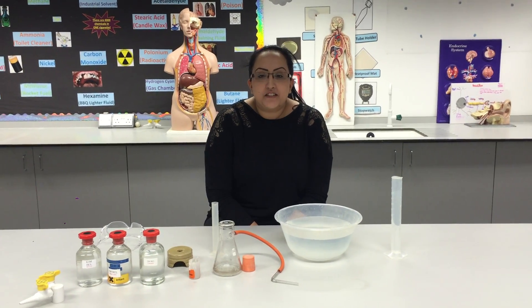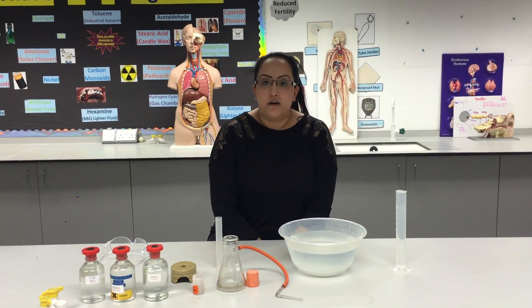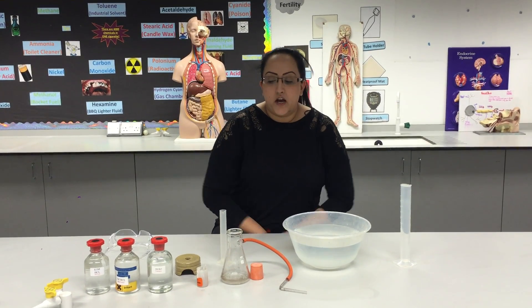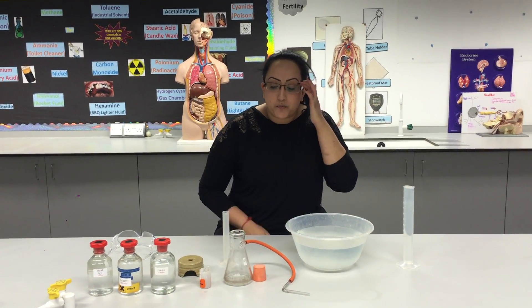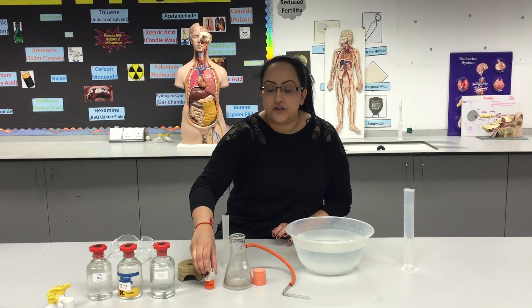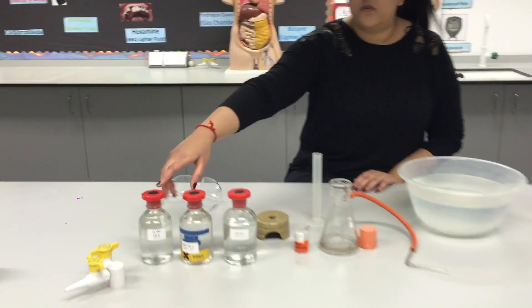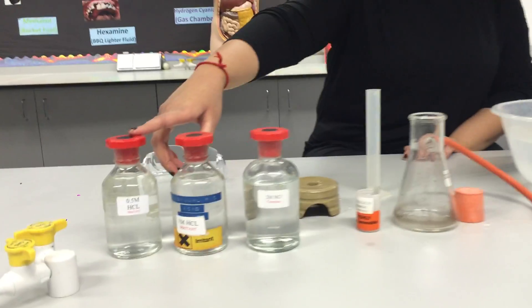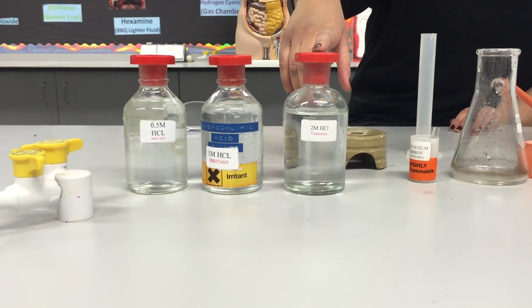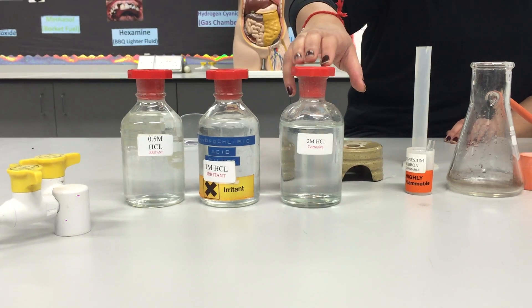In this video we're going to be talking about how concentration can affect the rate of a reaction. In our reaction we are going to be testing magnesium with hydrochloric acid and we've got three different concentrations: 0.5 molar, which is the weakest, 1 molar, and 2 molar acid, which is the most concentrated.